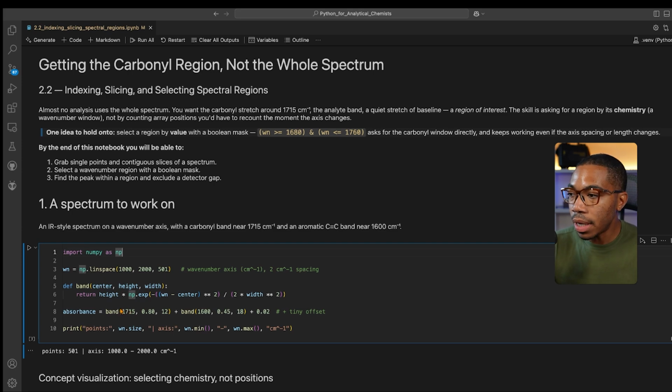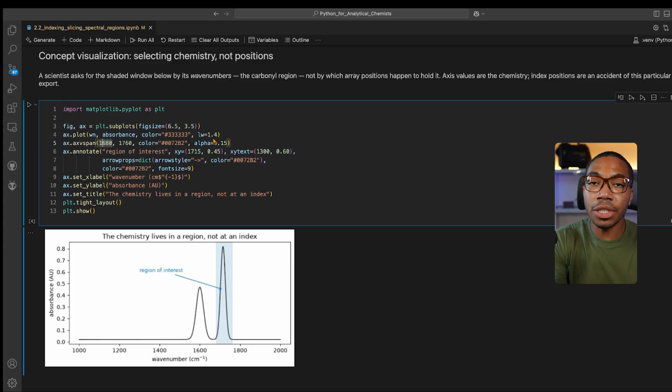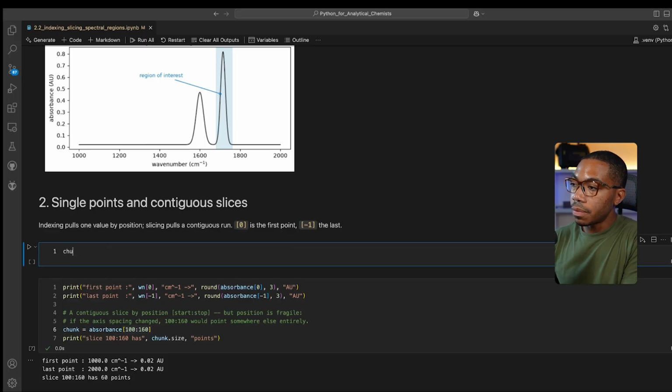So let's say we have two peaks, one at 1715 wavenumber and the other one at 1600 wavenumber. And if we were to plot that data, it would look something like this. And let's say our region of interest is between around 1700 to 1750 roughly. Now let's figure out how we can select this region using the data arrays that we have. So here is one way we can try to select a region from our data. I have an array called absorbance, and let's just say we have a chunk between index position 100 to 160. Let me illustrate what that looks like so that you can gain the same intuition that I have about this data. So let's just look at chunk.